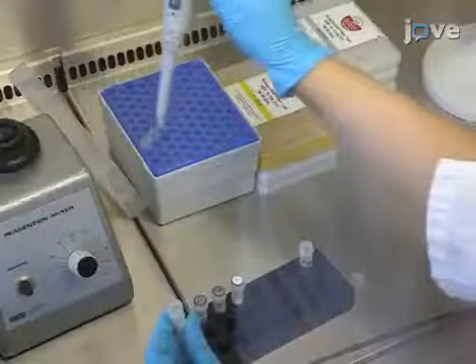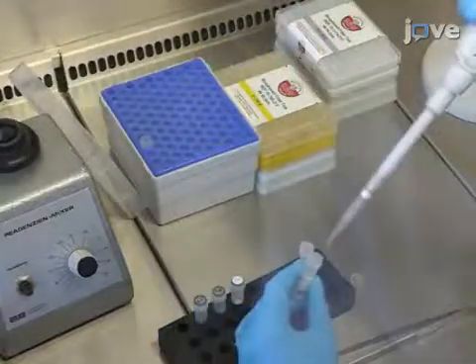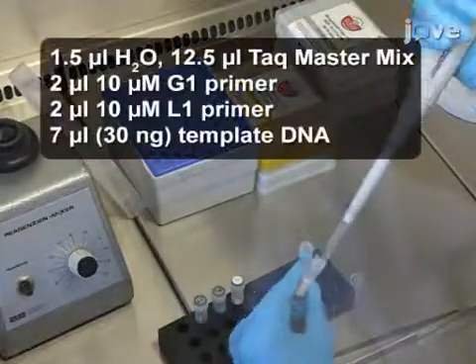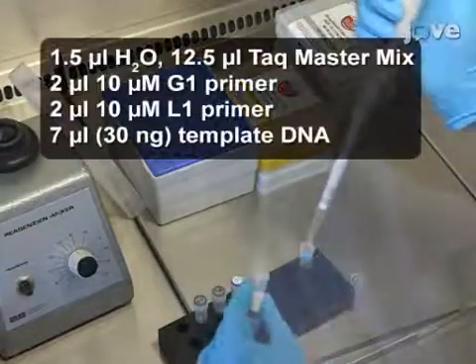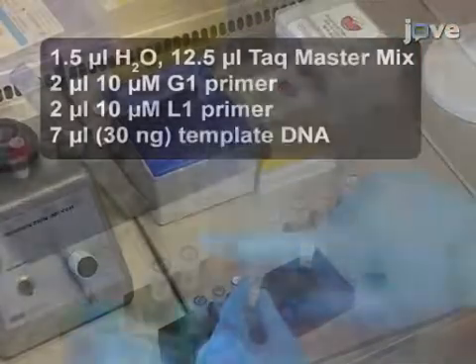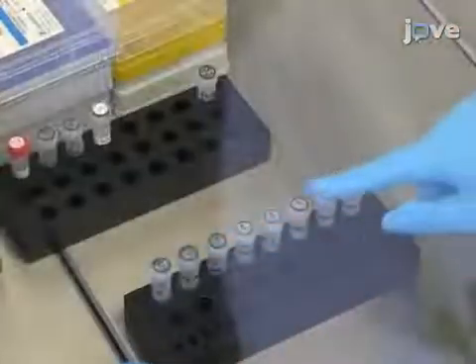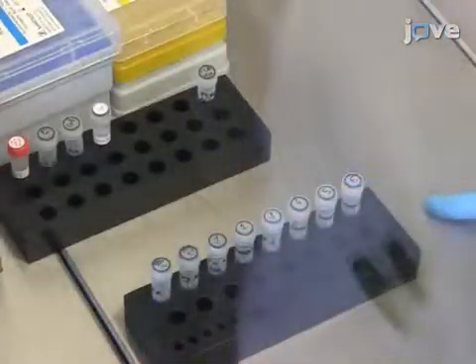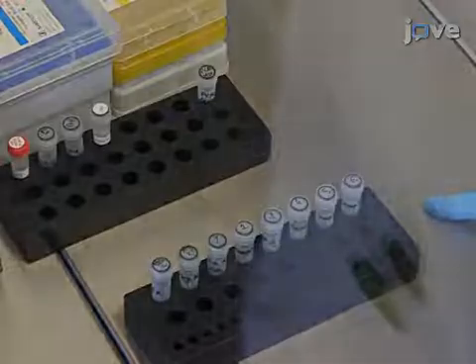Prepare a master mix by adding to a tube the reagents listed here. Then distribute it to PCR tubes and add the sample DNA. Include a positive control.